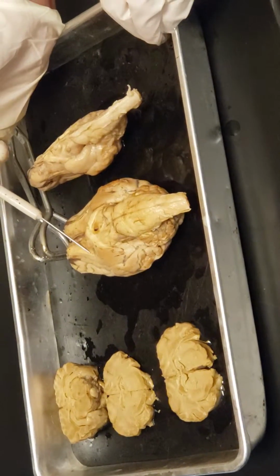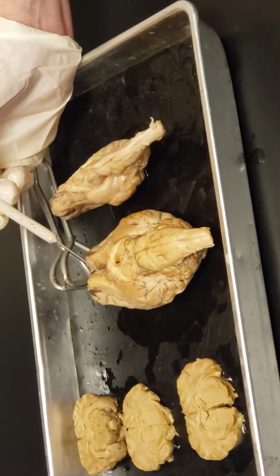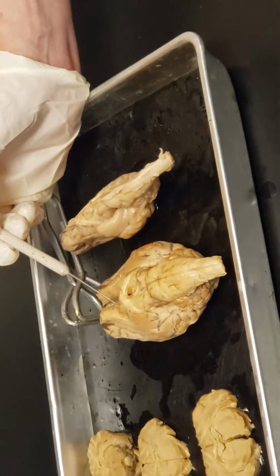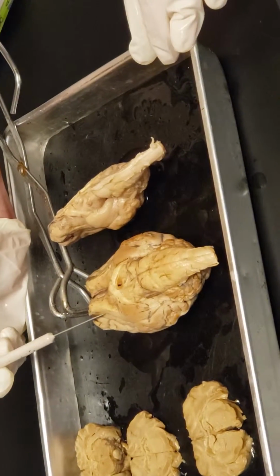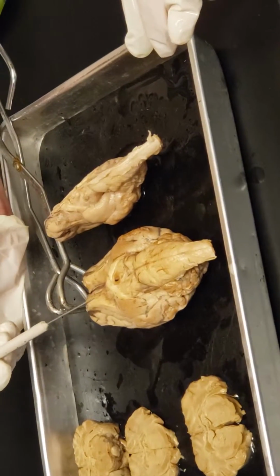through the olfactory tract. So the bundle that we called a nerve in the peripheral nervous system, we call it a tract when we're in the central nervous system. But same idea. It's going to be sort of what looks like a cut rubber band moving through the tissue. So that's the olfactory tract right there.